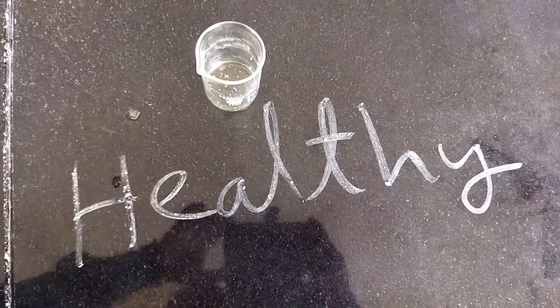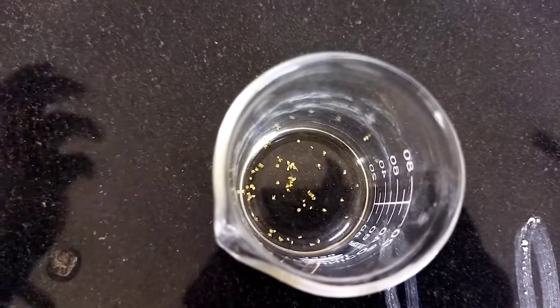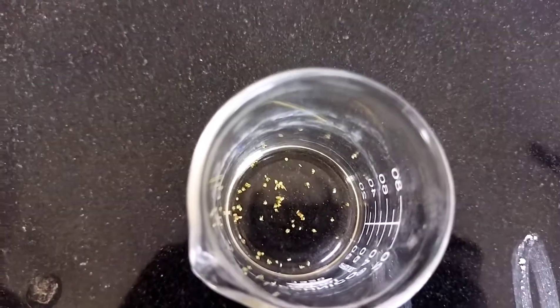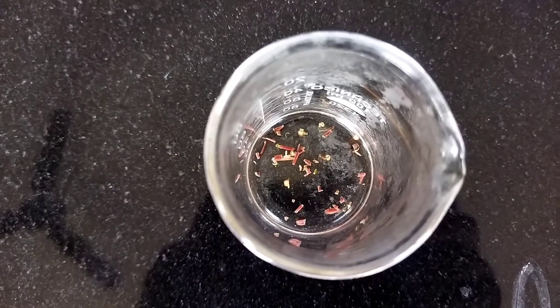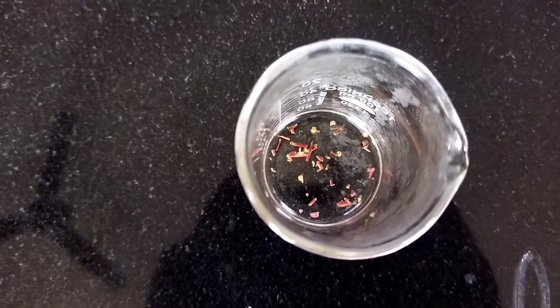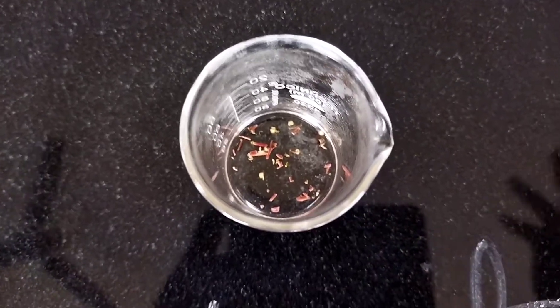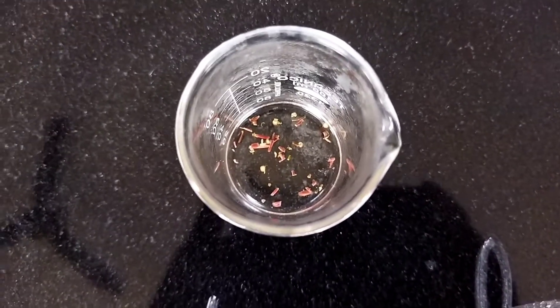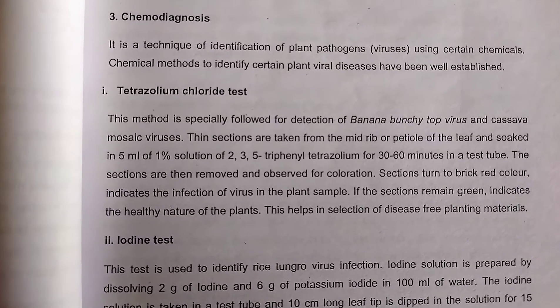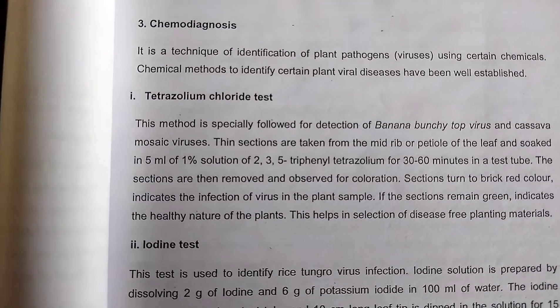The results show that the healthy leaf remains green in color after one hour of soaking in tetrazolium solution — you can see the green color tissue. In the case of the infected leaf, as per the theory, it produces a brick red color discoloration on the tissues. Through this chemo diagnosis we can identify viruses before symptoms are produced, so we can take preventive measures.